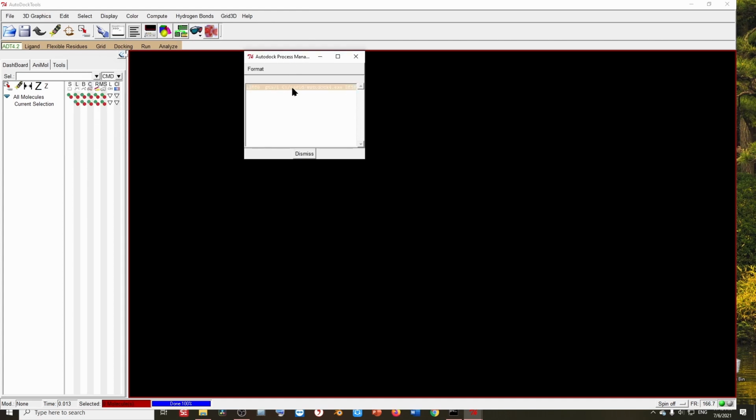It will actually take a lot of time. After about half an hour or 40 minutes, hopefully it will be successfully completed. So that's how you solve the problem. Thank you so much for watching this video.